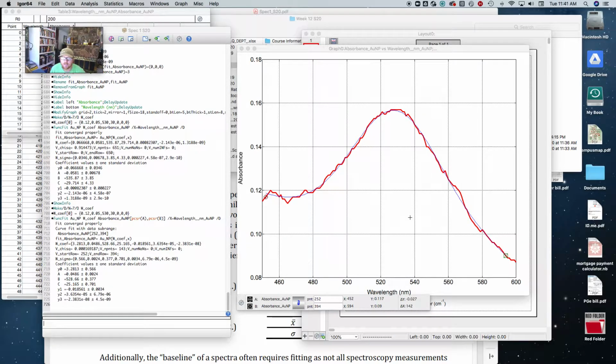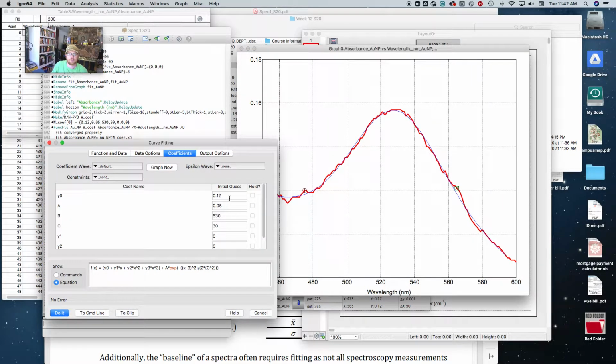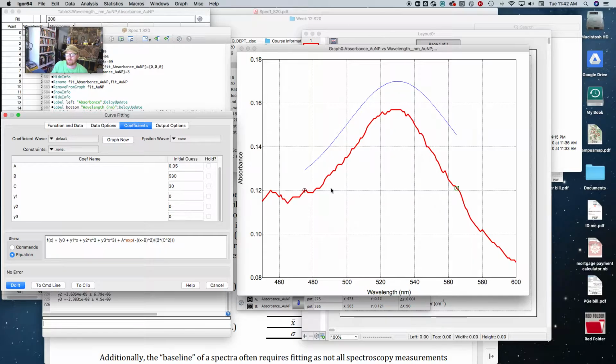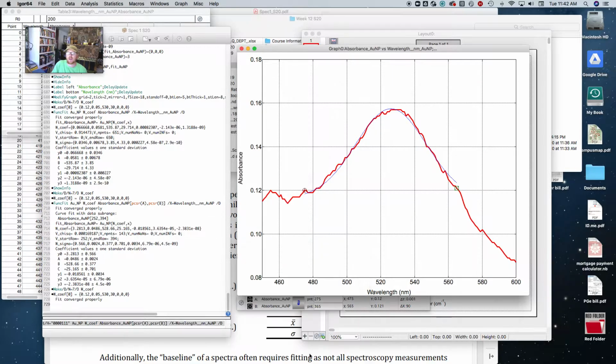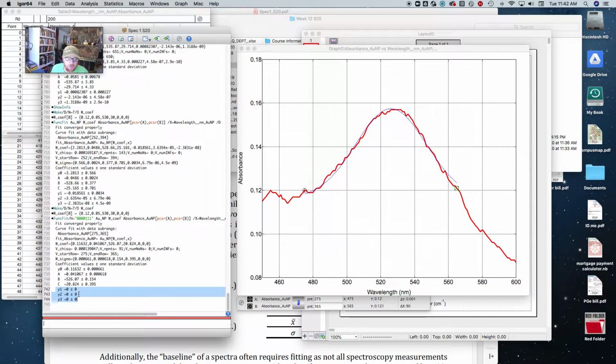So if it doesn't work like this right away, another thing that you can do, for example, I'm going to move these cursors a little bit closer into the main peak, right there, okay, and go back to analysis curve fitting. And then on my output coefficients, I'm just going to say, again, 0 on all these things. I'll say graph now. And you can see it's only graphing this small part of the region right here, okay? And I'm actually going to force all of these to stay 0 to prove a point here. There we go. So now all of my polynomial terms I forced to be 0, and my baseline term is coming out to be about 0.11 or so. And so you can see that's fitting the Gaussian really nicely.